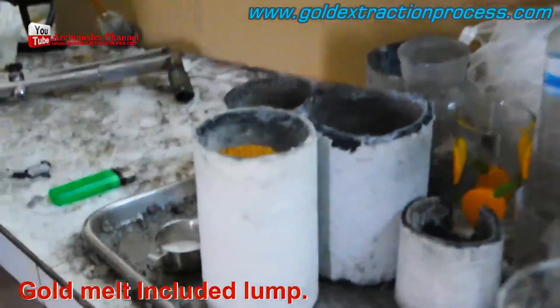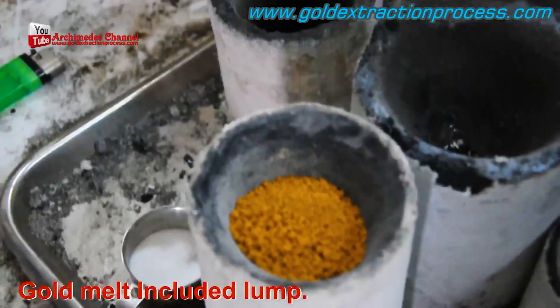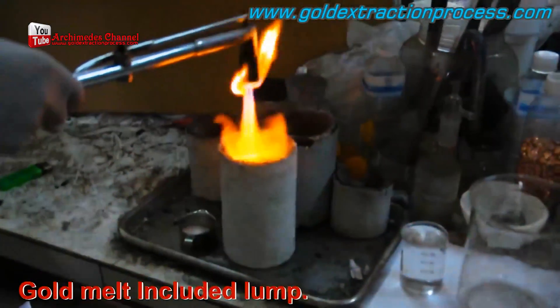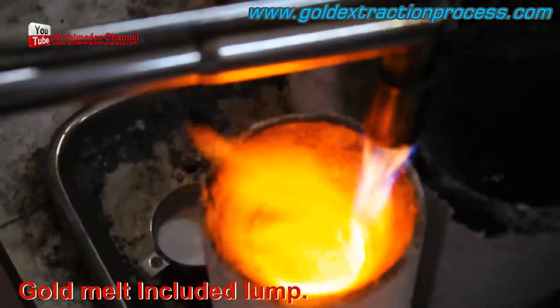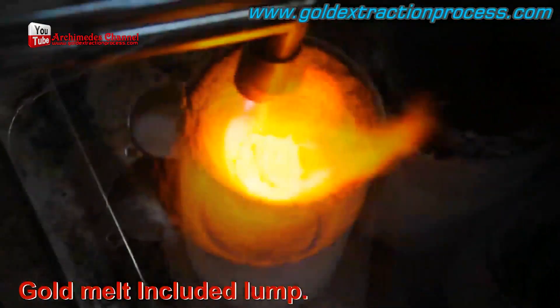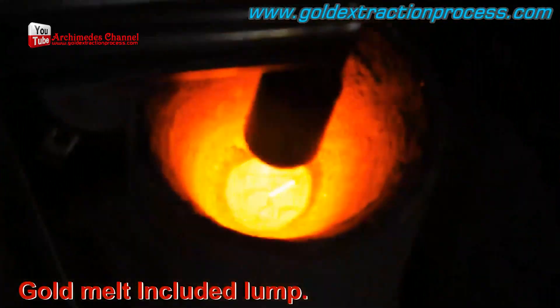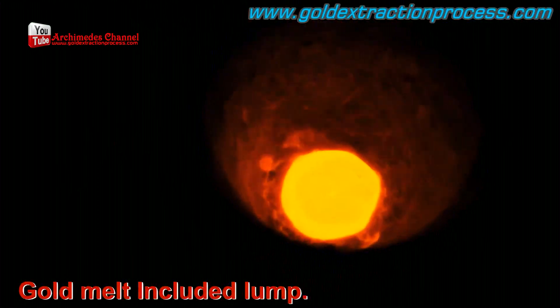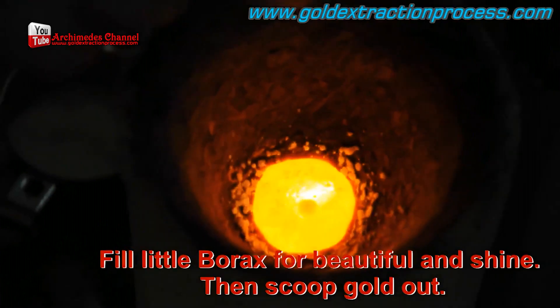Once that's done, use an electric stove with gentle heating to dry it out into a powder. You're almost there. That powder is then dropped into another heating station and carefully torched from a safe distance so as not to blow the dust everywhere. Watch as it starts to heat up and turn gold — now properly refined.